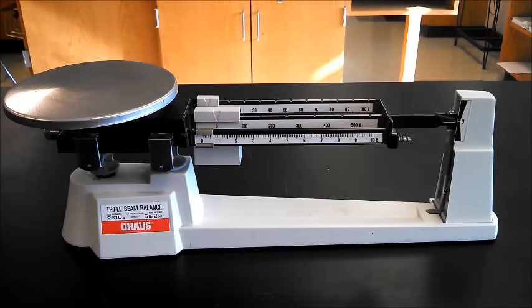The triple beam balance is one of the most common scientific instruments that we're going to use in science class. We use the triple beam balance to find the mass of an object in grams.